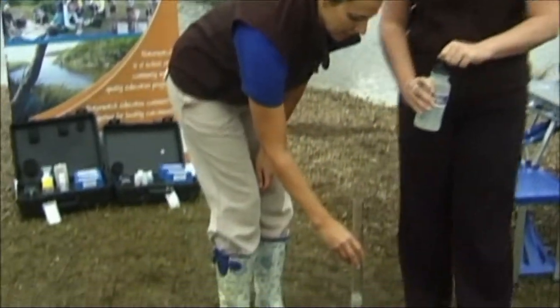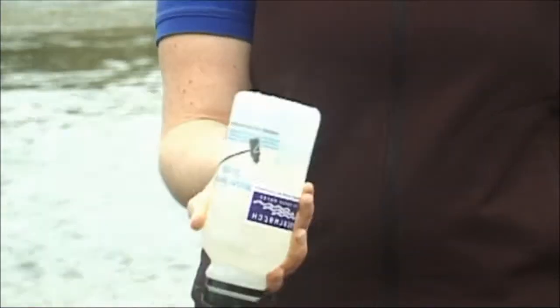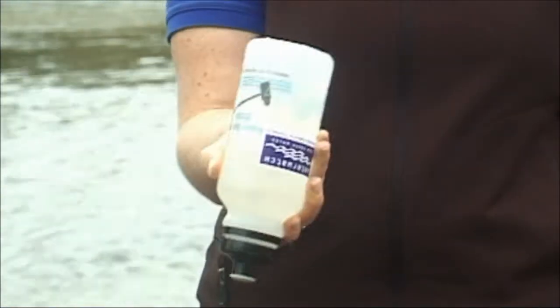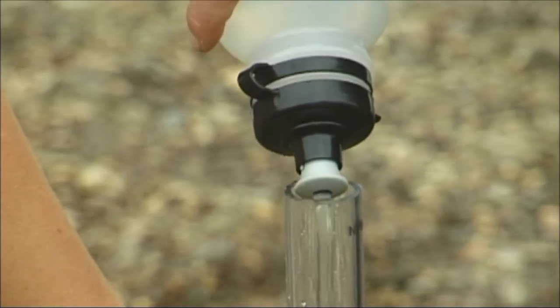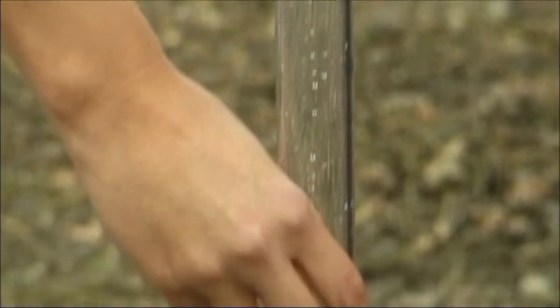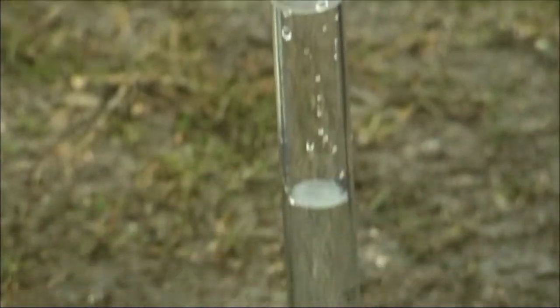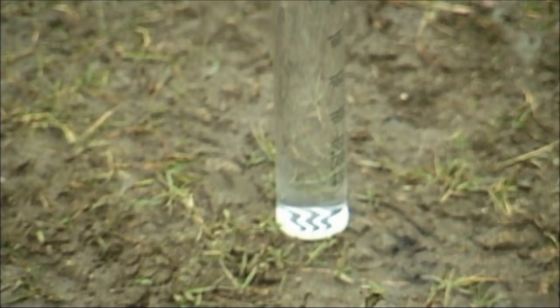One person can hold the tube upright on the ground while the other pours. Shake the sample bottle and slowly pour the water into the tube. Pour a little at a time, stop and wait for the water to stop swirling, then look down into the tube. Stop pouring when the white space between the three distinct black lines at the bottom of the tube cannot be seen clearly.